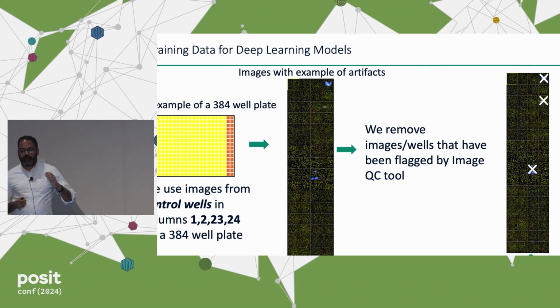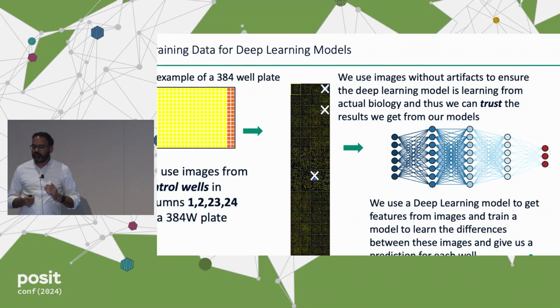Now, as you can see in the middle, these are the images that come out of those wells. And you can see there are some that have artifacts in them. So then we use our QC tool. It marks those images and flags them as it should. Once that's done, we get rid of those images from our deep learning model, then we train it. The main goal of doing this is to make sure that the deep learning model is using really high quality images that have actual biology or changes happening in them and not artifacts. Because again, if they have artifacts, you can't trust the results coming out of these deep learning models.